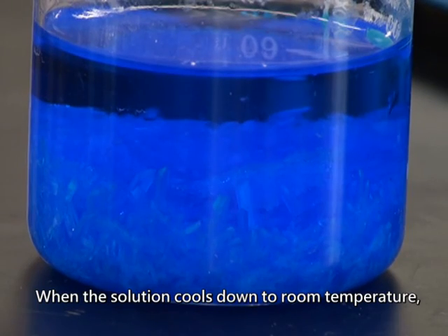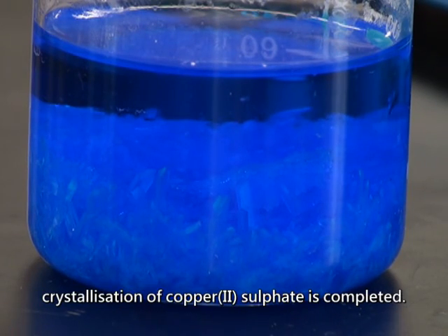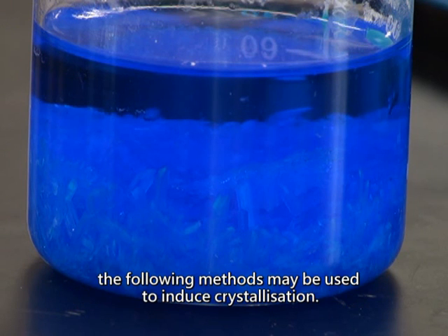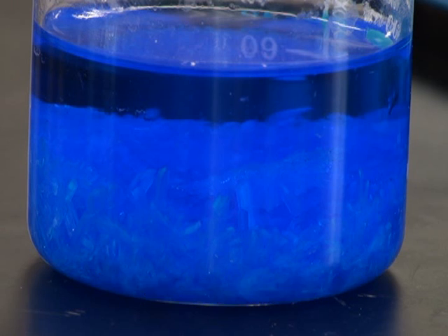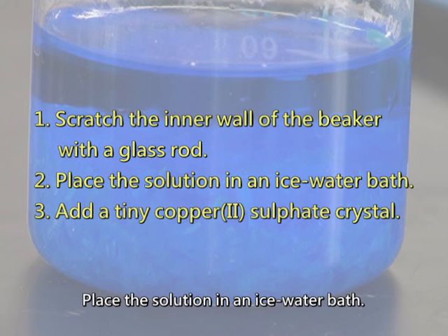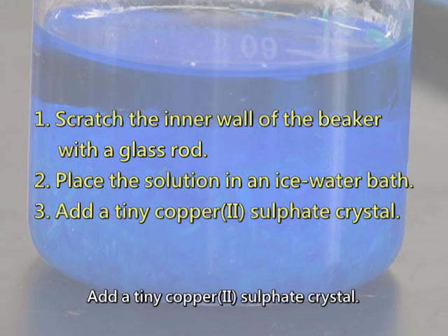When the solution cools down to room temperature, crystallization of copper-2 sulfate is completed. If there is no crystal formed after cooling the solution to room temperature, the following methods may be used to induce crystallization. Scratch the inner wall of the beaker with a glass rod. Place the solution in an ice water bath. Add a tiny copper-2 sulfate crystal.